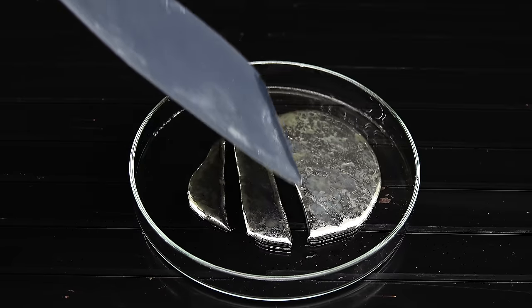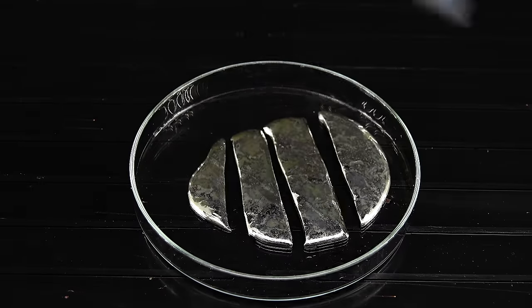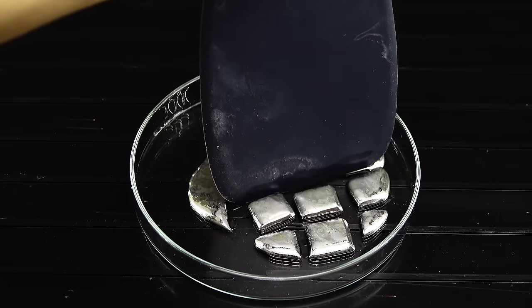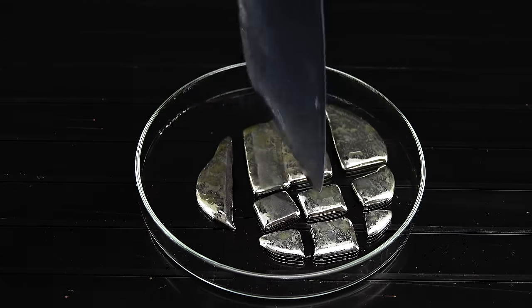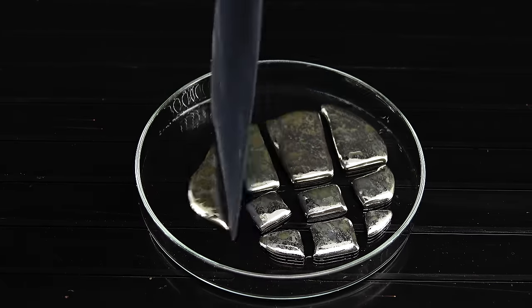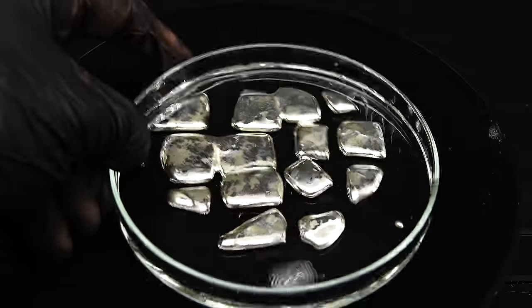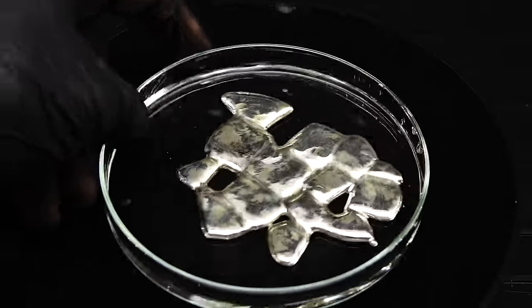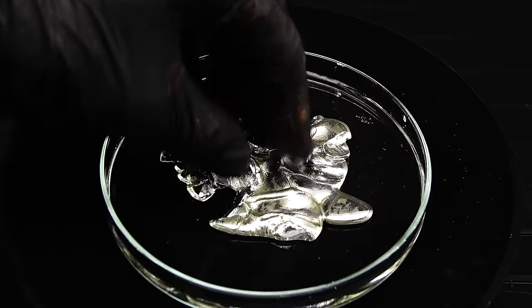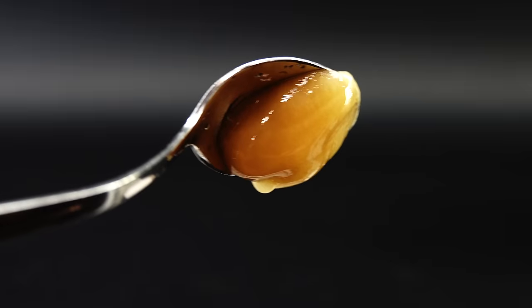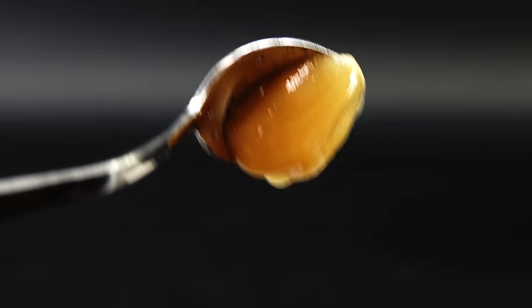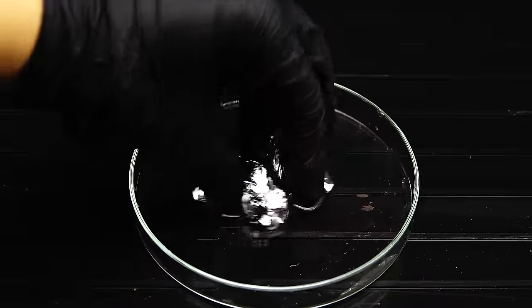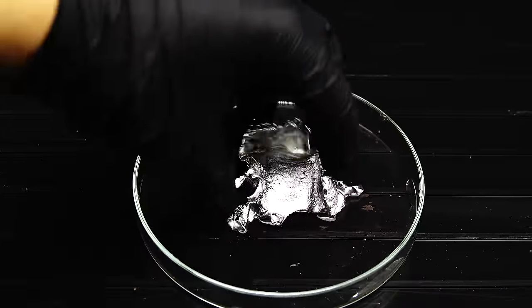From a chemical perspective, it's a solution of copper in mercury, which is really weird to say, since to a chemist who normally works with aqueous or organic solutions, copper isn't something that is able to dissolve. The texture of this metal solution also depends heavily on the ratio of copper to mercury, and it's now quite saturated, and you can think of it like metal honey, which normally is an extremely saturated solution of sugar. When it comes to its chemical properties, it isn't supposed to be too reactive, since mercury is a very unreactive metal.